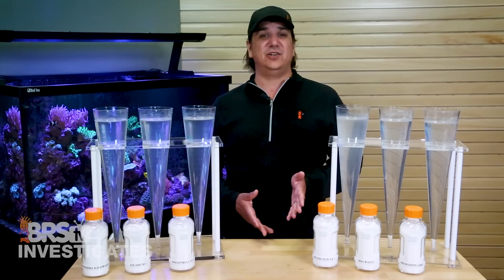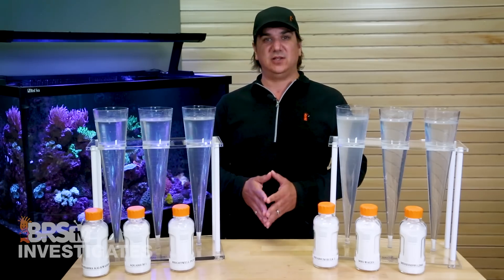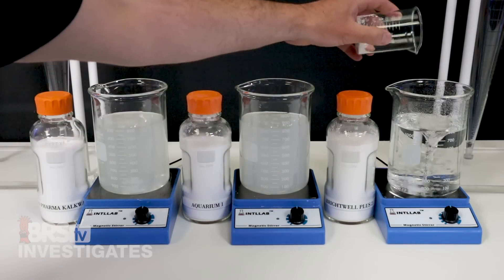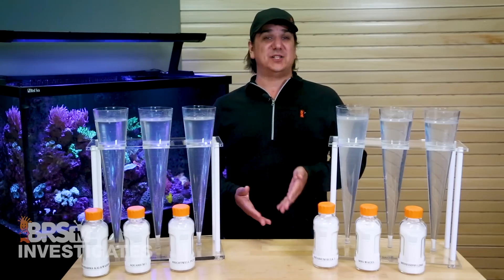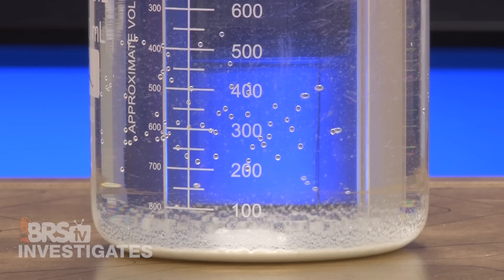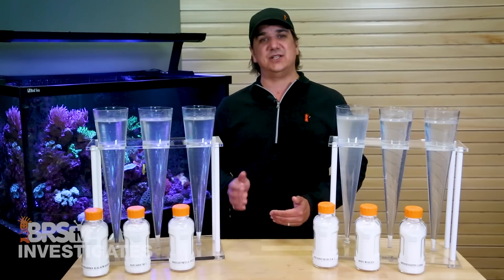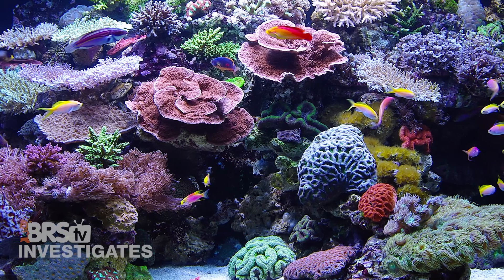So this is how we're going to test the materials. I collected some samples from our shelves, ordered a couple we don't stock, went to a big box hardware store for the Pickling Lime, and ordered the Mississippi Lime from a local chemical supplier. We're going to take visual assessments by mixing 1.33 grams in a liter of RODI water and assessing clarity, total volume of water insolubles, and potency after a handful of minutes of mixing. A visual assessment will only tell you so much, but honestly if you can see it with the naked eye, it's not a trace element. If it turns muddy brown, rusty red, or has a large amount of insoluble crud at the bottom, I don't really care what the ICP-MS testing says — I'm personally not going to use it in my reef tank. There are just too many other affordable and safe options to gamble an often multi-thousand dollar investment in my reef tank on something I can see with the naked eye is dirty.